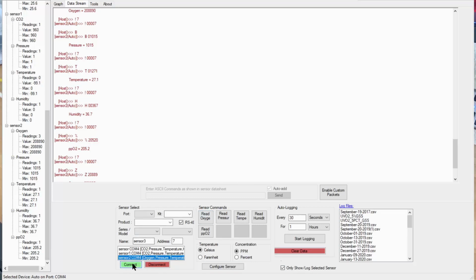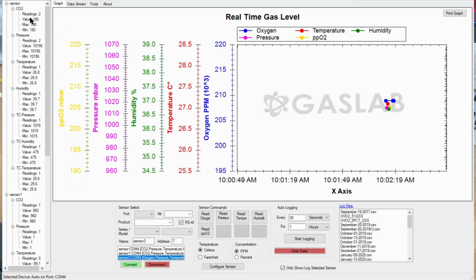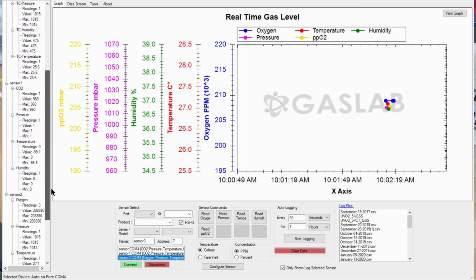So, back to the graphing screen. You'll notice on the side here there is a bar, and it keeps track of the readings that you've made on each sensor, what the value was, highs and lows and all that kind of thing, so that you can get a running operation on the sensors that are now connected in a group. You know, this is 485. You can run this for hundreds of feet without a problem. These things don't consume very much current, so you can really run a whole raft of sensors out there, like all over a machine, and just tie it together with a four-wire bus or a flat ribbon cable bus, however you want to go about it. Very, very flexible.